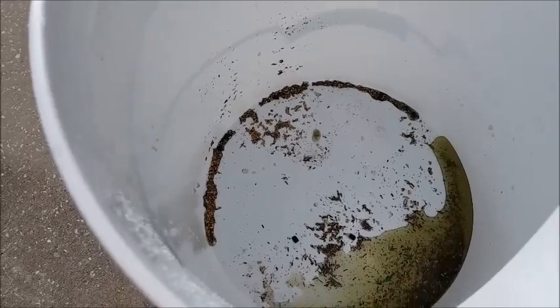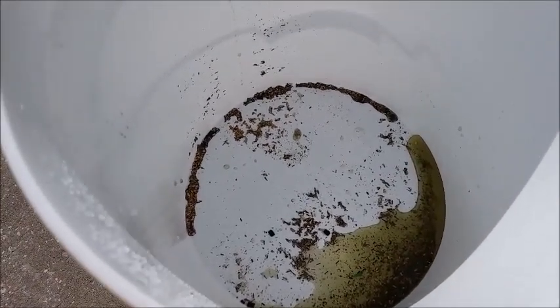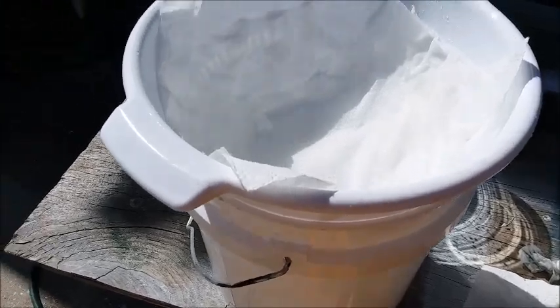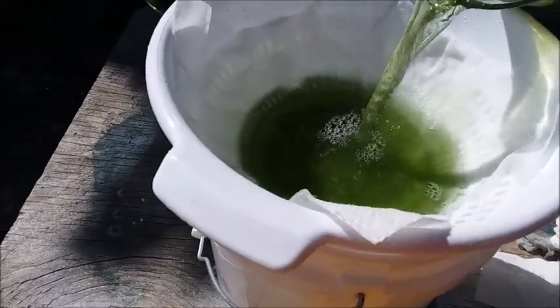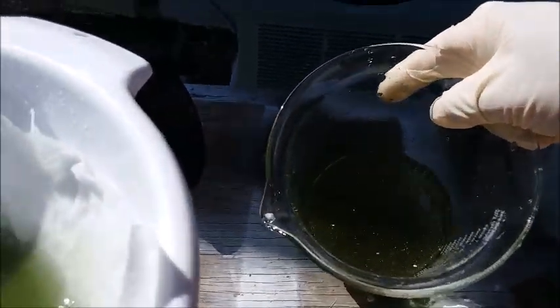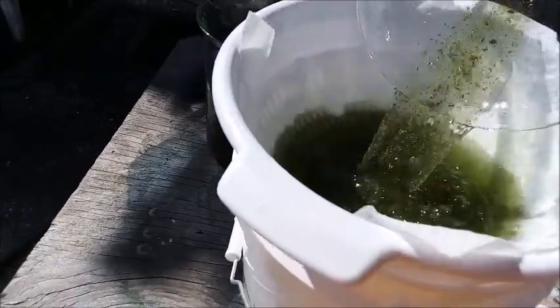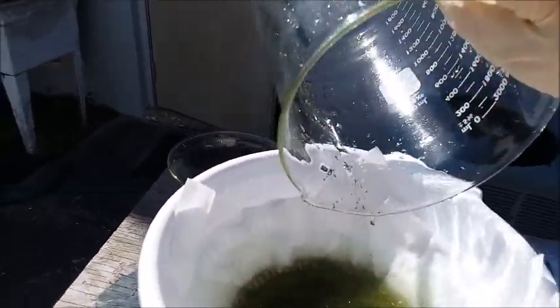I need to wash the buckets out into the beaker and re-filter everything through the colander to catch all the gold on the paper towels. Now I'm all set up to filter through the colander — this should go a lot quicker. It was absolutely murder trying to do this through the coffee filter. Look at all the gold in there — wow! I'll get the spray bottle and wash everything out into the filter to get it all in there.